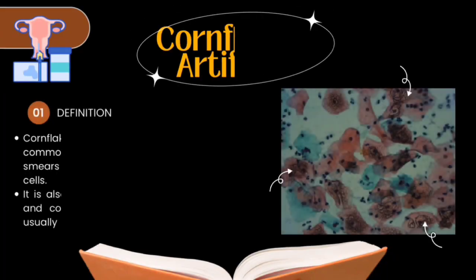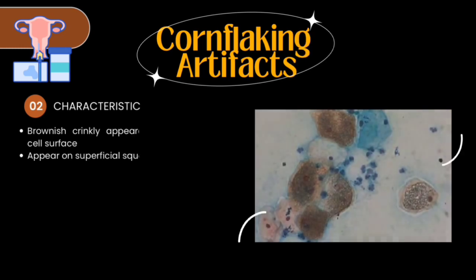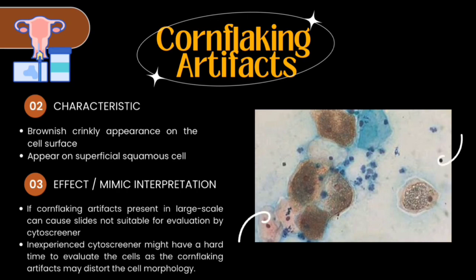The first artifact that may appear in cytological smears is cornflaking artifact, which is a common phenomenon, especially in pap smears. It is also an air bubble artifact that is brown and conceals the nuclei of superficial cells. It has a brownish crinkly appearance and mostly appears on superficial squamous cells.